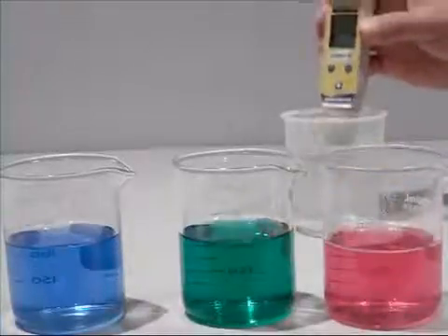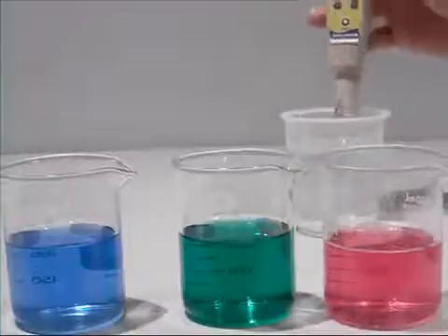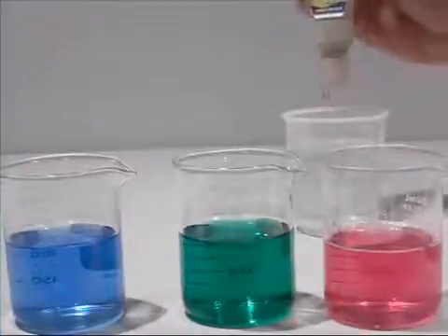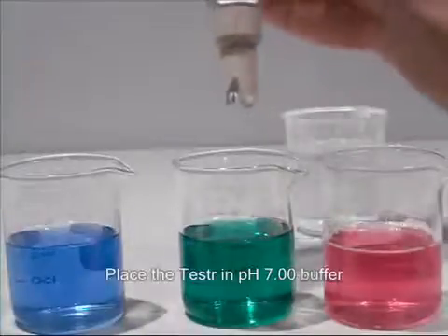Before calibrating, rinse your pH electrode, press the on-off button to switch the unit on, and then place the electrode in pH 7 buffer solution.